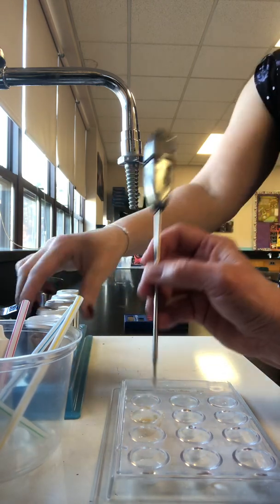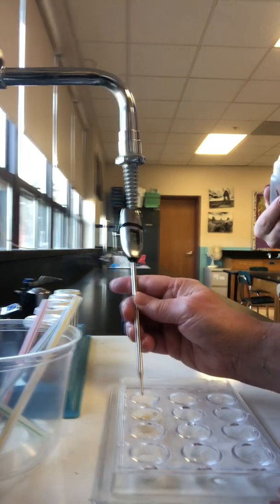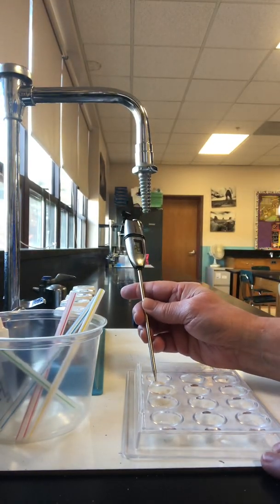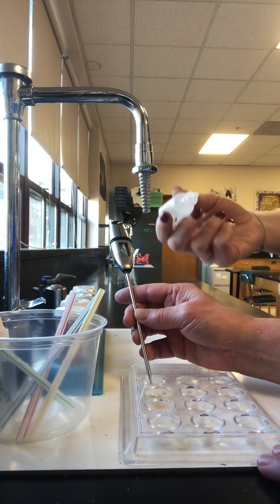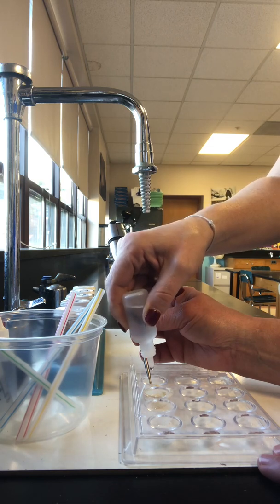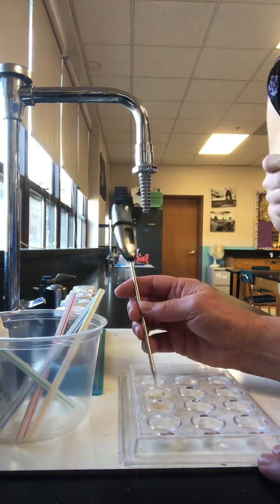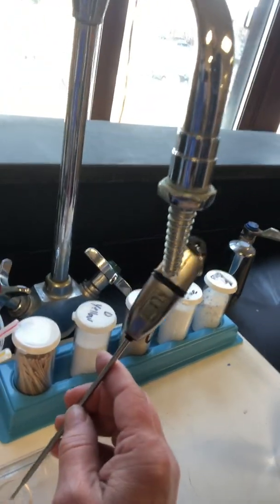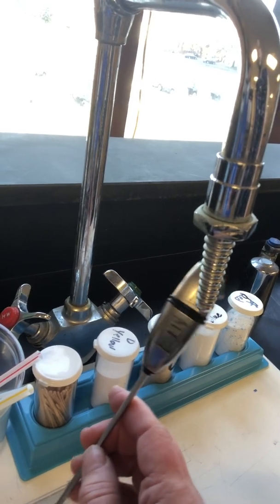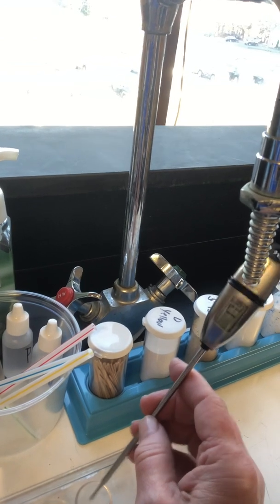And then the last one, we're going to use vinegar. Starting at 22.3. 22.3 to start, and we're going to add 10 drops of vinegar. 1, 2, 3, 4, 5, 6, 7, 8, 9, 10. Okay, notice it's bubbling and fizzing. And the thermometer is reading 17. 17.7. Okay. Yep, that was the low, 17.7.